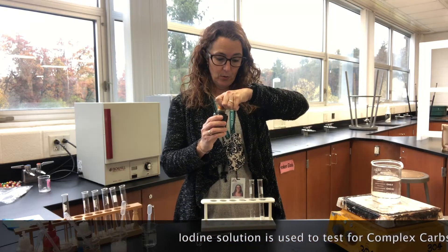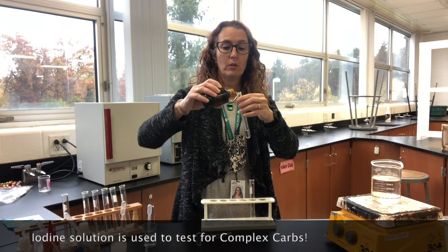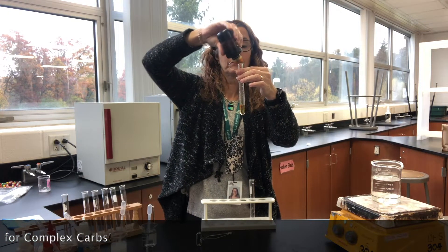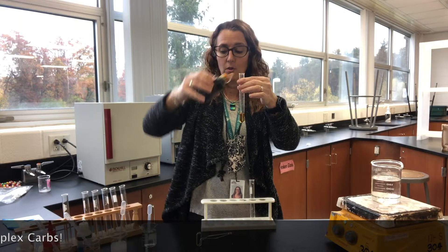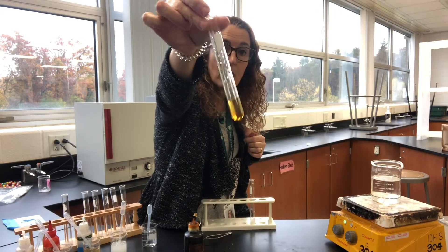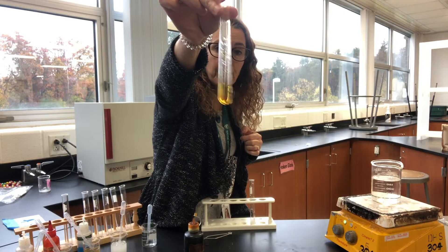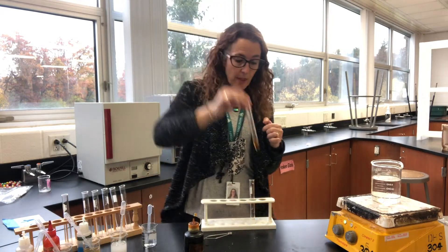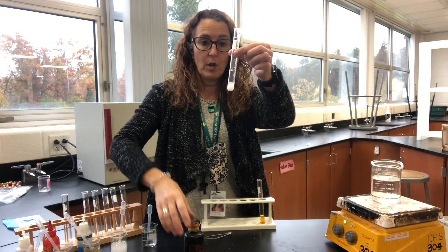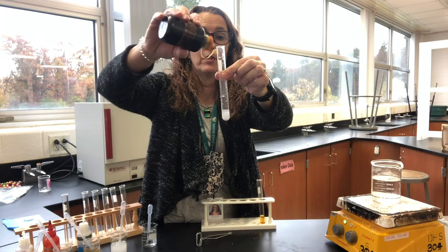To test for complex carbohydrates we use a solution called iodine solution. When you put iodine into regular water, you'll see it just turns a light brown color. When there is starch present, it should do a completely different color change, so I'm going to put some drops in for you to see.